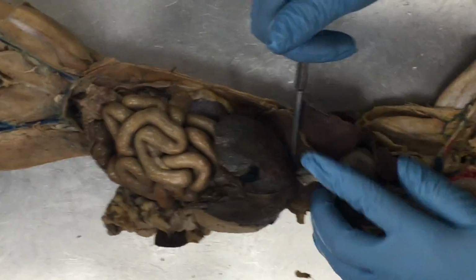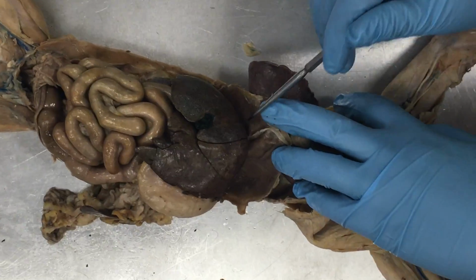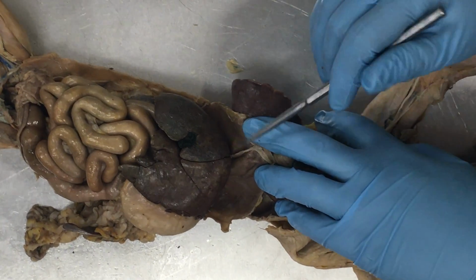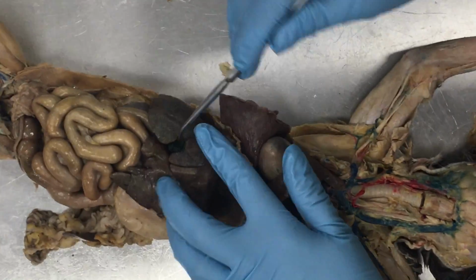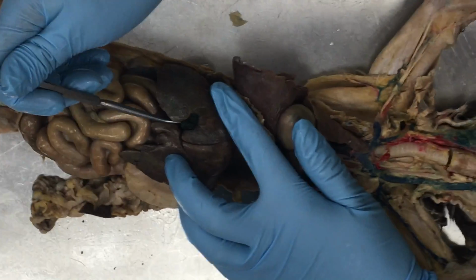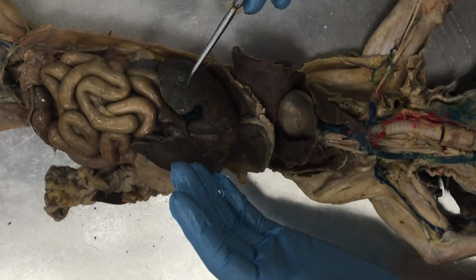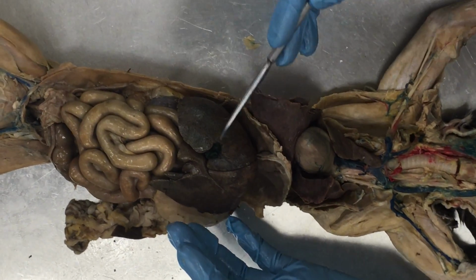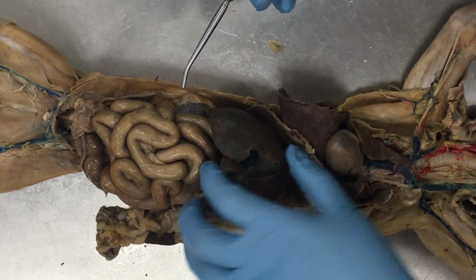Above the liver, we have this clear sheet of connective tissue that's holding our liver up to our diaphragm. That's our falciform ligament. Stuck into the right medial lobe, there's this green sort of sac. It's generally going to be deflated on your cats. This is the cat's gallbladder. All right. The gallbladder and the liver work together to make and store bile. Bile is ultimately going to be ejected into the duodenum, so we need to find a couple of ducts.